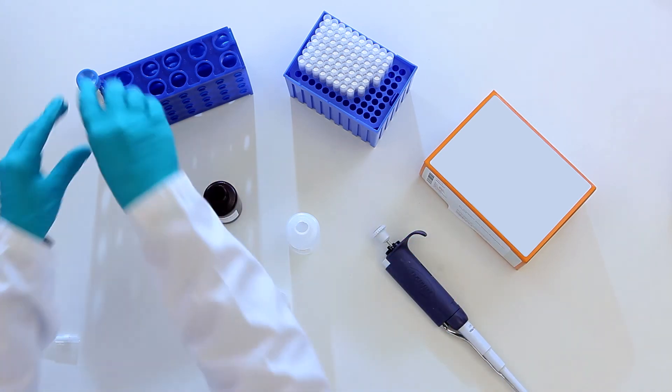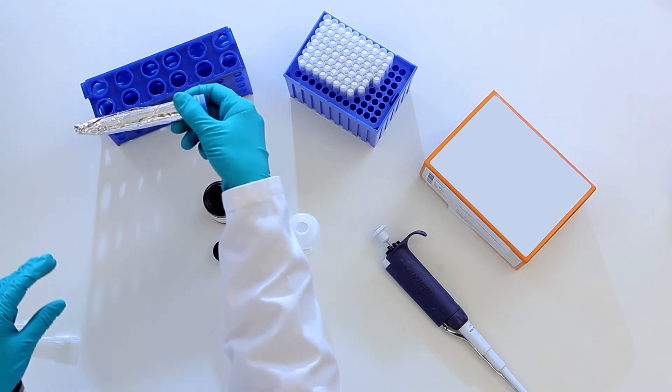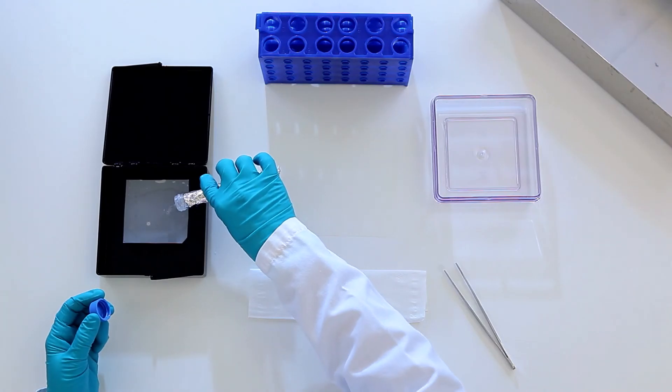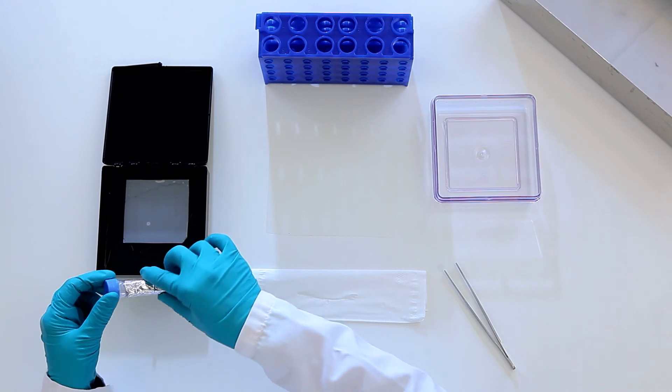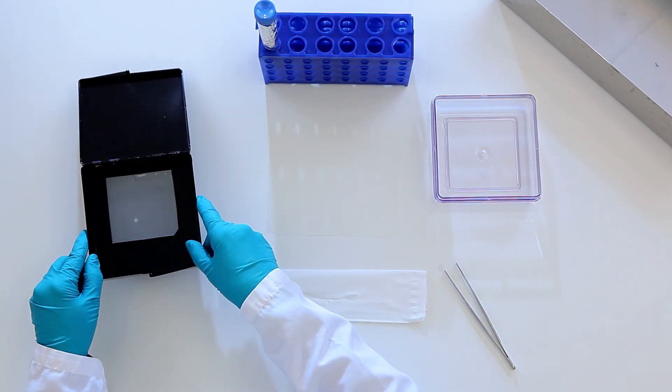Prepare the detection reagent according to instructions. Allow it to warm up to room temperature in the dark. Make certain the entire membrane is covered with reagent. Incubate the membrane for five minutes at room temperature.